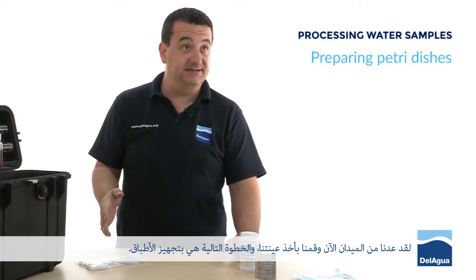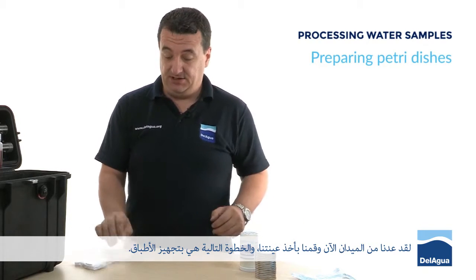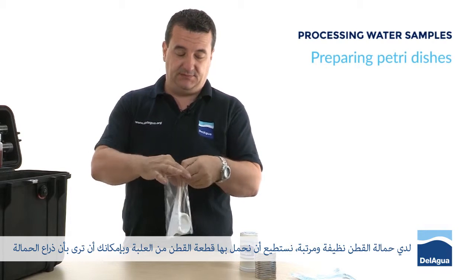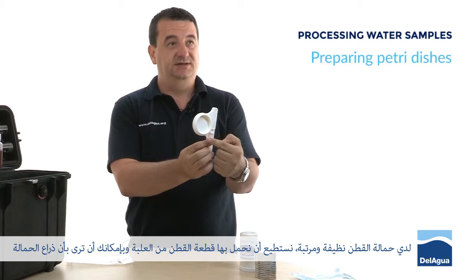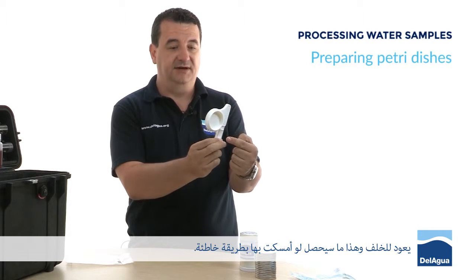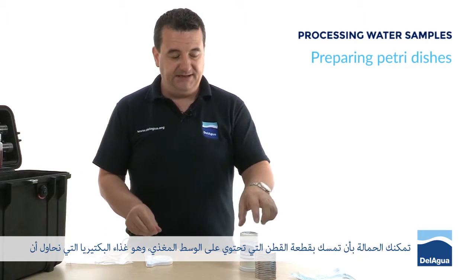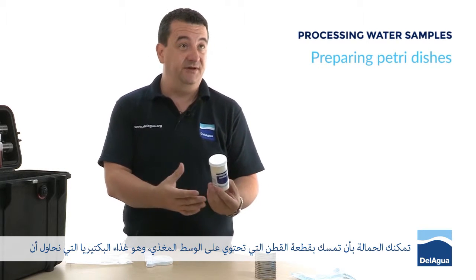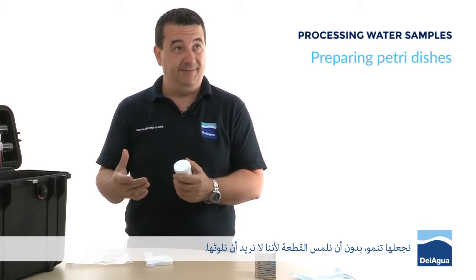We're back in from the field and we've collected our sample. The next thing we need to do is prepare the petri dish. We've got a pad dispenser — nice and clean. Take that out of the packet. Inside you can see the arm is retracted. That's what it would look like if it's the wrong way around. The purpose of the pad dispenser is to allow us to put the pad — which holds the media, which is the food for the bacteria we're trying to grow — without actually touching the pad, because we don't want to contaminate it.